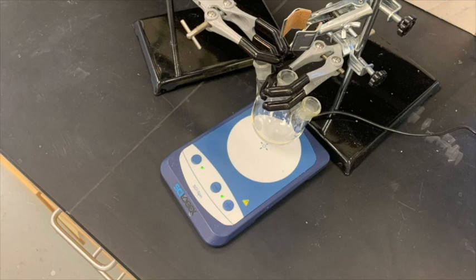Before we get started, you'll need a few things, including a three-necked round-bottom flask, three different clamps on two ring stands set up as pictured above, and a magnetic stir plate.